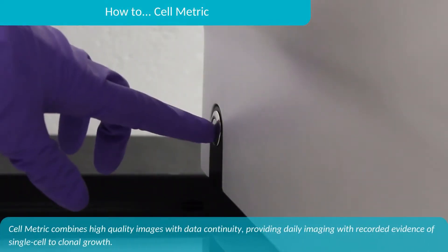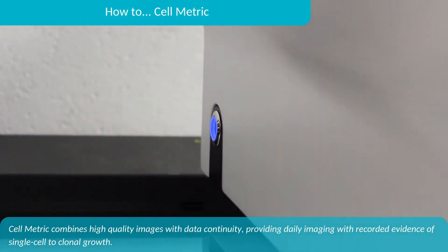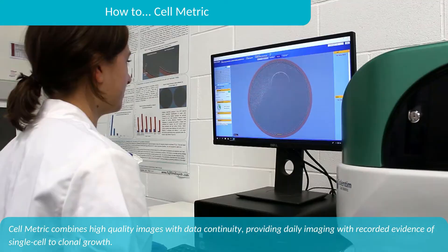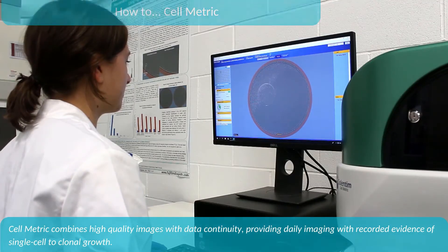Cellmetric combines high quality images with data continuity, providing daily imaging with recorded evidence of single cell to clonal growth.